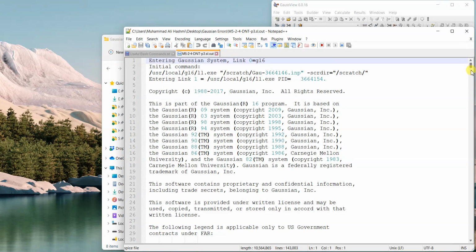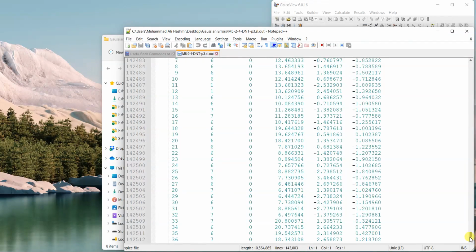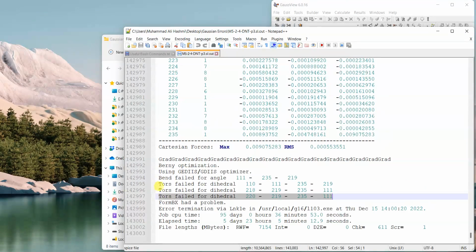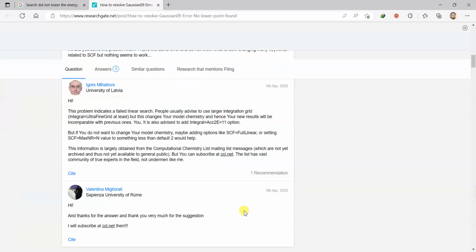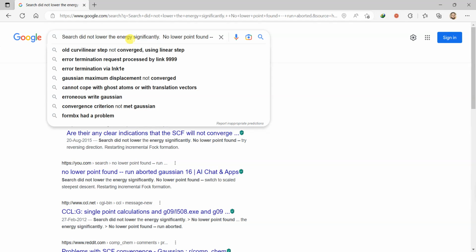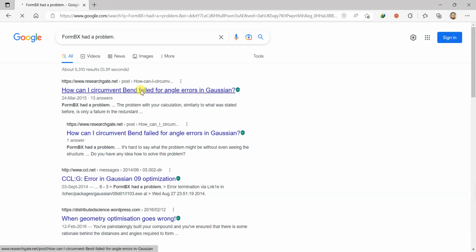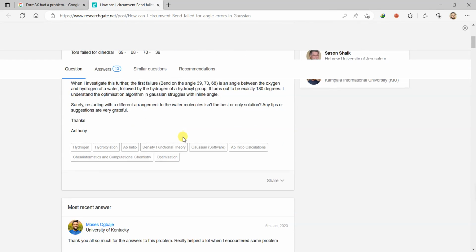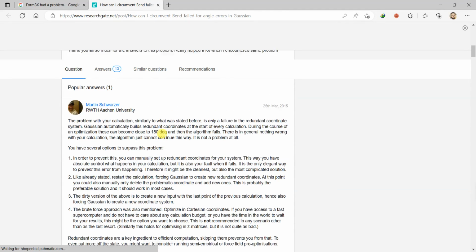So let's open another file. If we go to the bottom of this file, what's in there? Let's have a look. So yes, in this case, torsion failed for dihedral. This is an error which is also quite common for some structures. And if I Google it, let's have a look. Yeah, someone has asked on ResearchGate about the same question. So, popular answers. Here is the popular answer.